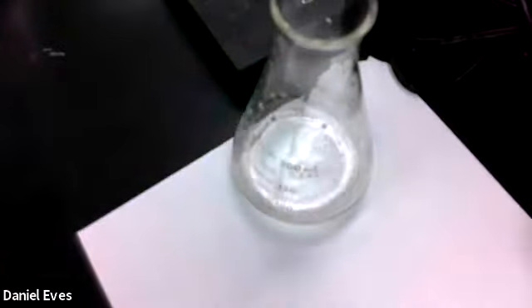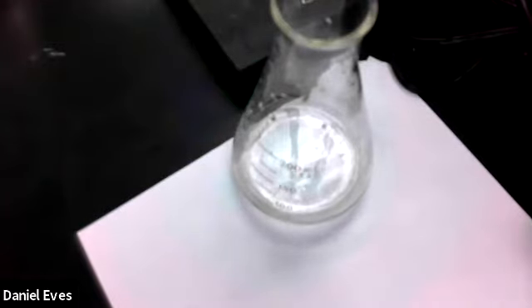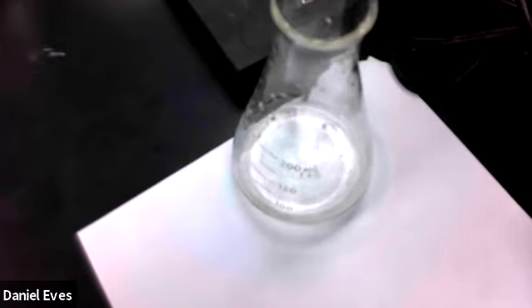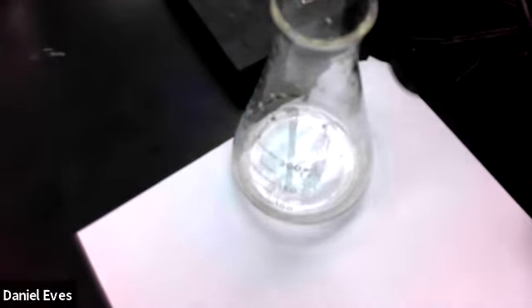So to this, I need to add my phenolphthalein. So I put in 0.2 grams of an unknown acid, and I'm using my sodium hydroxide solution. Now this one, I would show it to you, but I'm afraid that my shaky hand would not do it justice. So we are right on 0 milliliters on our burette. So our initial reading on the burette should be 0. So let's go ahead and start titrating this sample.